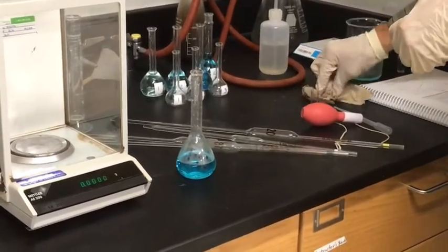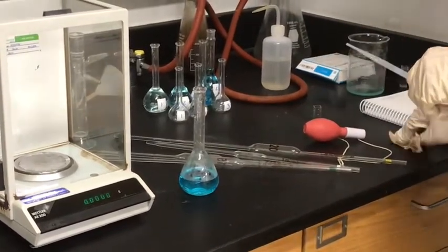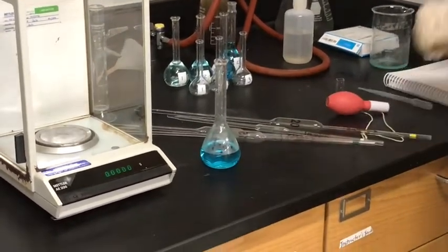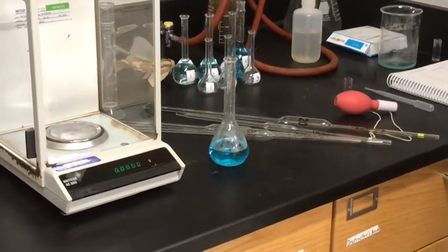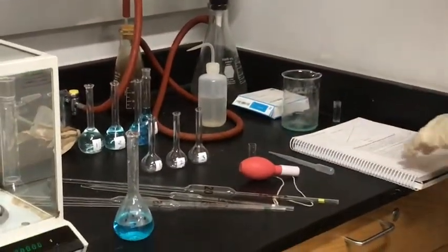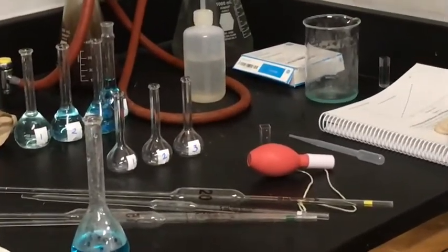In this next part, we're going to start with the stock solution for the first one, but then each one after that, we're going to use the one that we just prepared in the previous step. So this will be a serial dilution. These are labeled 1 through 3. I guess it was actually supposed to be A, B, and C, but that'll be fine.